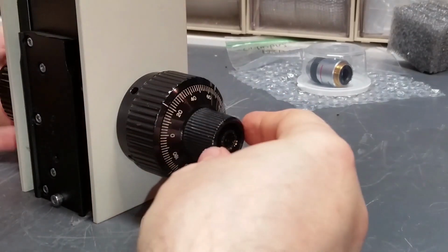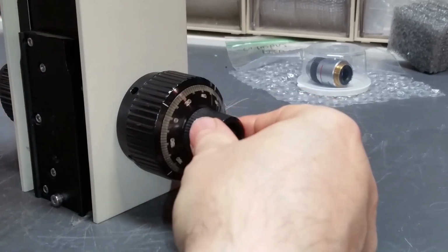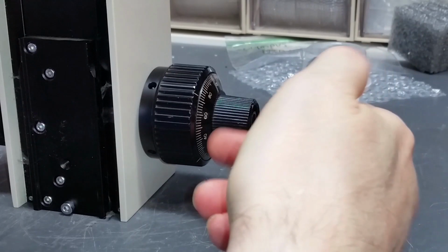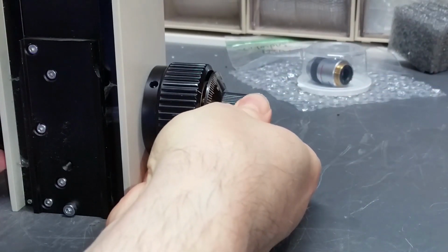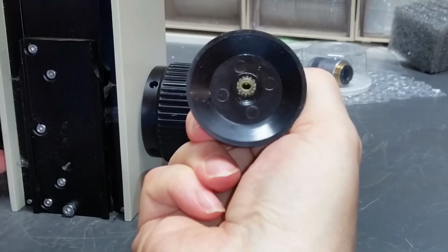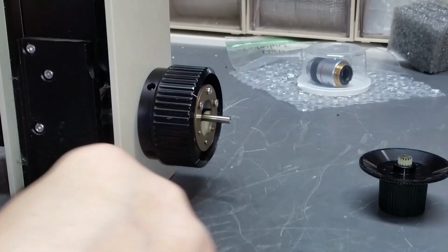And when I did that, this was the side with the screw loosened on, and that's unusual. Ordinarily, the other side loosens, but in this case, this is the screw. This is the side that's got the fine focus gear in there. And so that's the one that loosened, and that's also where the bend is at. So since that screw is out, all I've got to do to take the knob off is just carefully pull this out. At that point, the knob and the fine focus gear, as you can see, that gear is intact and seems to be in good shape. These come off, and we're left with the fine focus shaft sticking out of here.